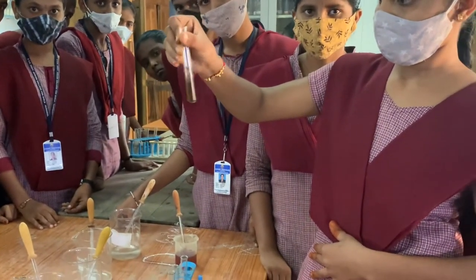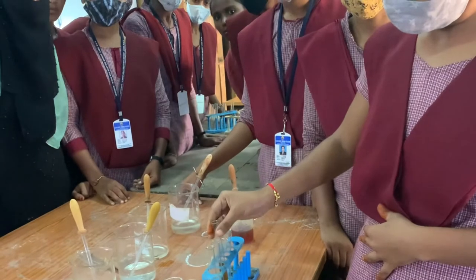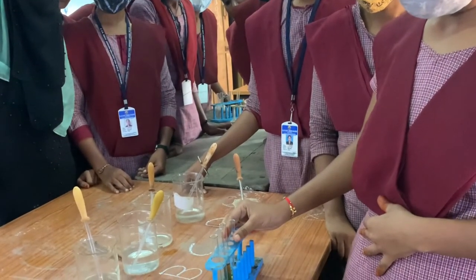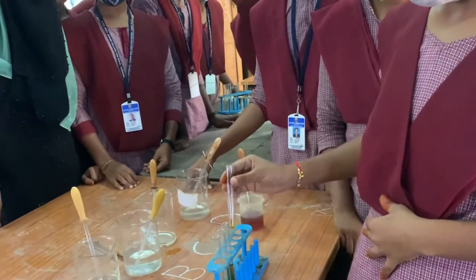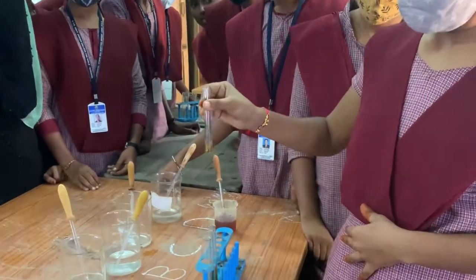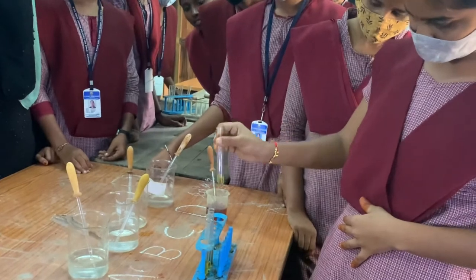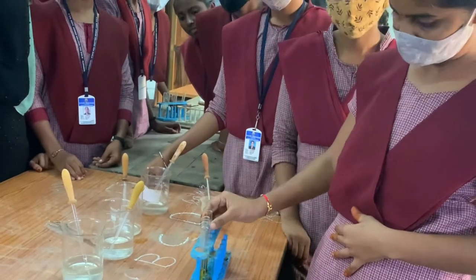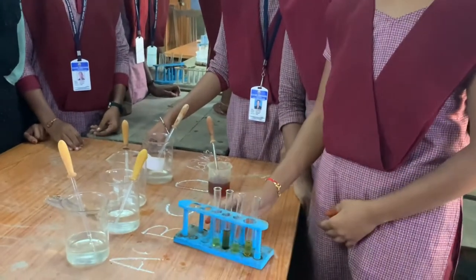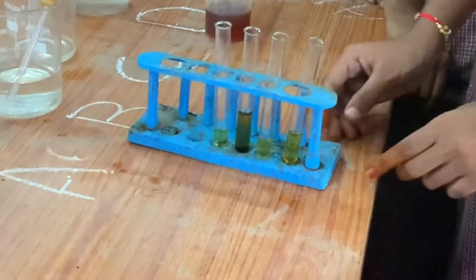So in sample C, starch is present. In sample D, there is also no colour change, so starch is absent. When iodine solution is added and the solution turns blue, that determines the presence of starch.